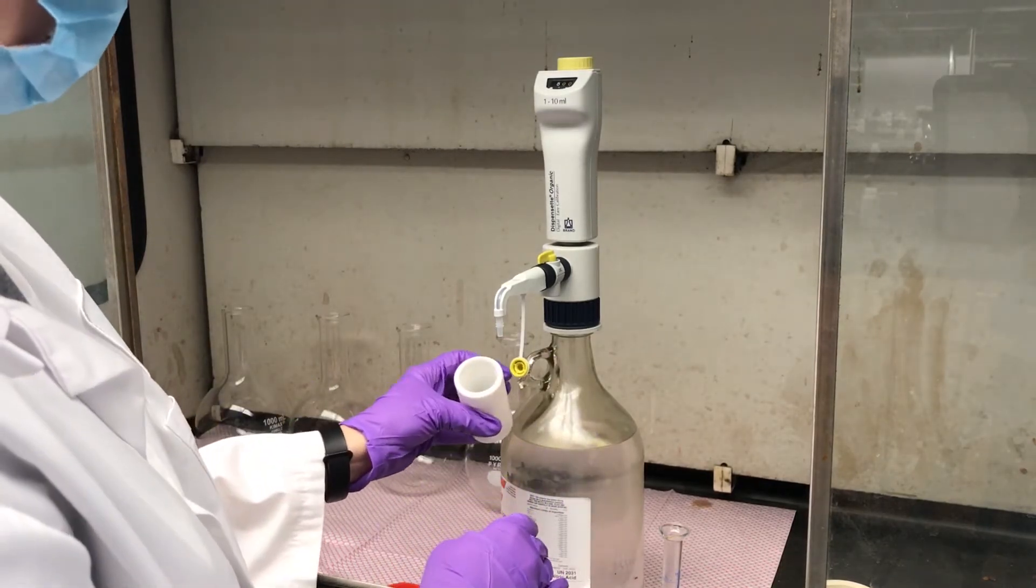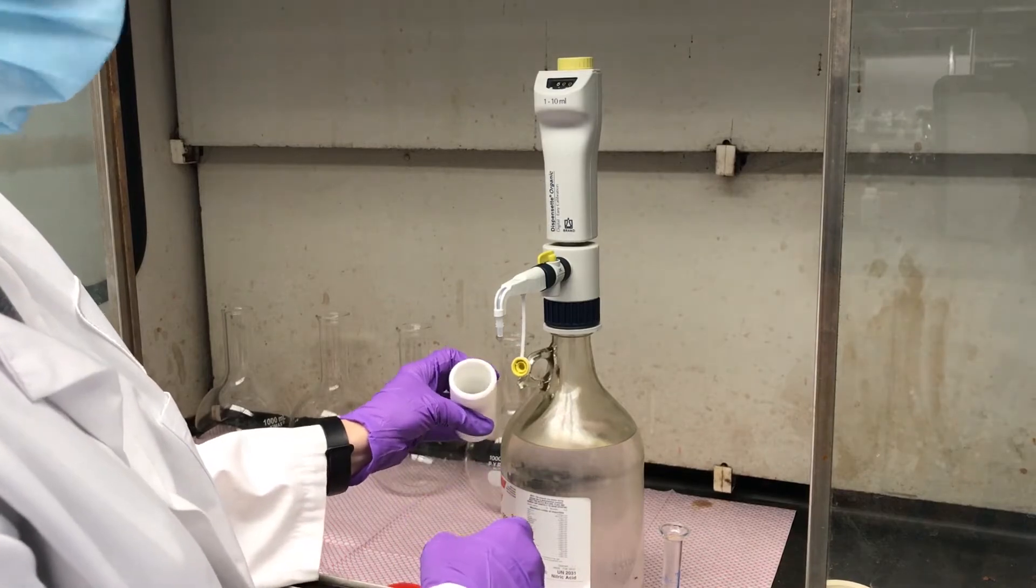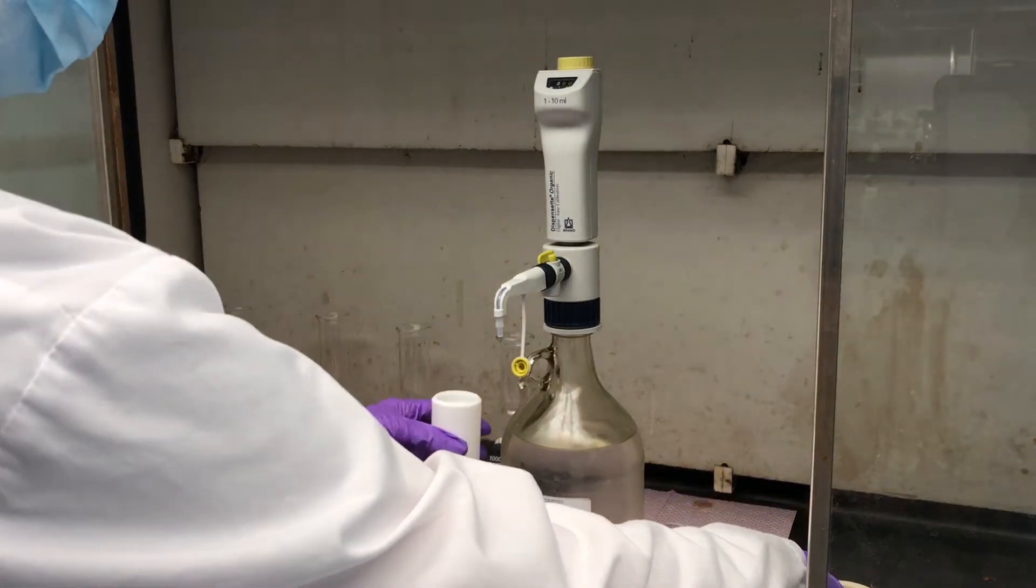Keep this in the hood and you'll notice there is some bubbling. That's the digestion process getting all ready.